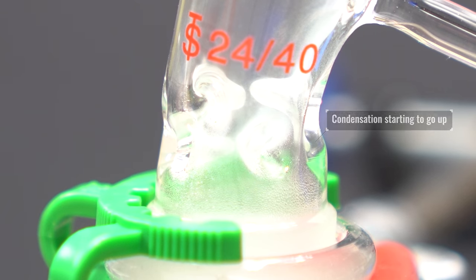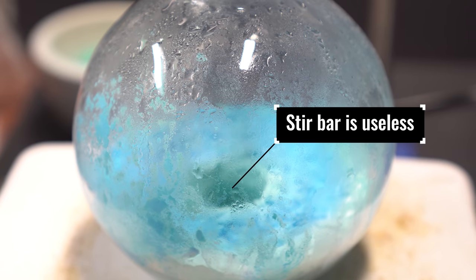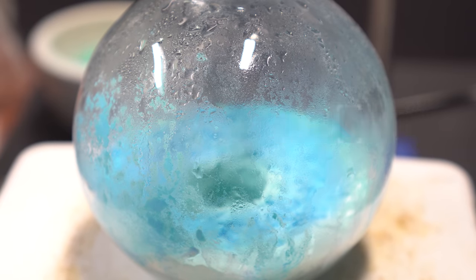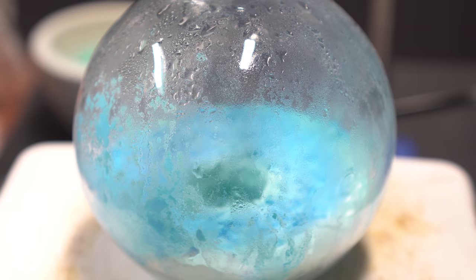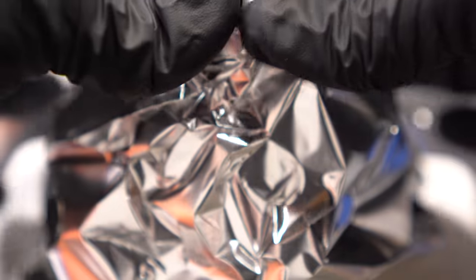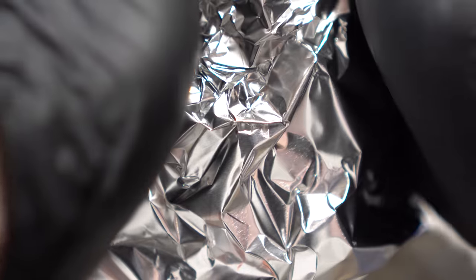But like a stable excitement, not like a batshit crazy excitement. I just can't get over how useless this stir bar is. I will literally roast the shit out of it every chance I get. I also want to mention how blue the powder has gotten inside the flask. I also wrapped the entire reaction flask with some aluminum foil. So just in case it failed, I didn't have to see it.